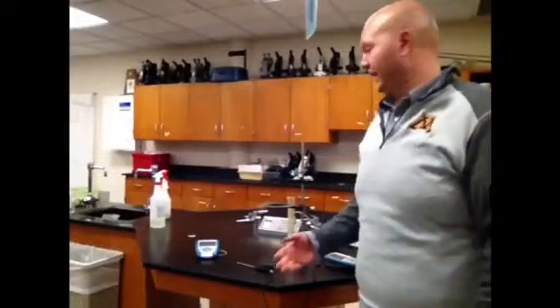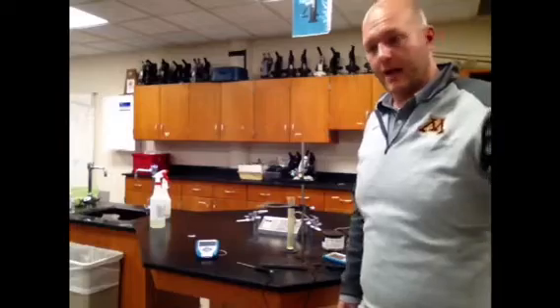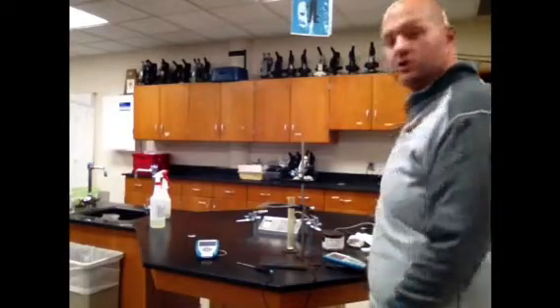We start this whole one up again. We have to restart by doing the same things we did before. So now we need to find the mass of the empty can. The can is 24.82 grams this time. That's different than the last time, so make sure you write that down in your data table, 24.82 grams.